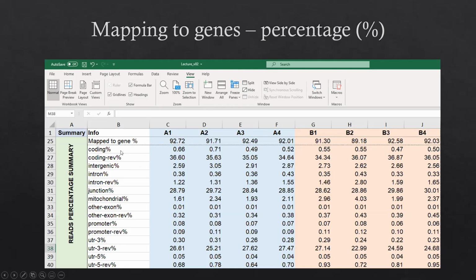The first one is that you may already realize that there are two rows, coding and coding reverse. This indicates whether the protocol is strand specific or not. If you see about the same ratio of coding and coding reverse, or intron and intron reverse, other exon and other exon reverse, it means you may have used a non-strand-specific protocol. In this case, you can clearly see the bias on the coding reverse strand, which means the sequencing was performed with a strand-specific protocol.